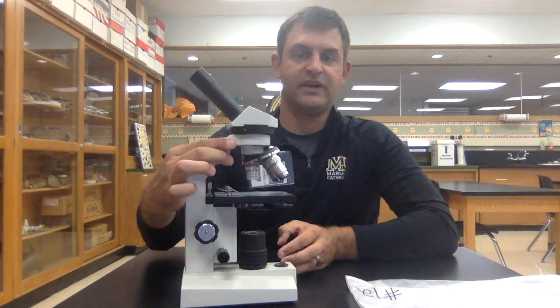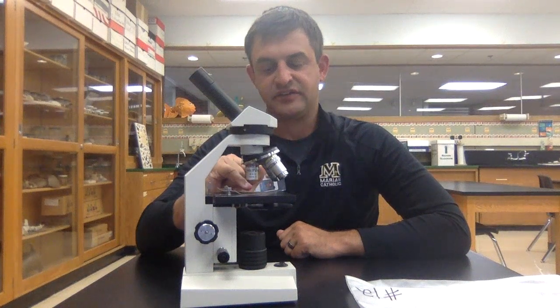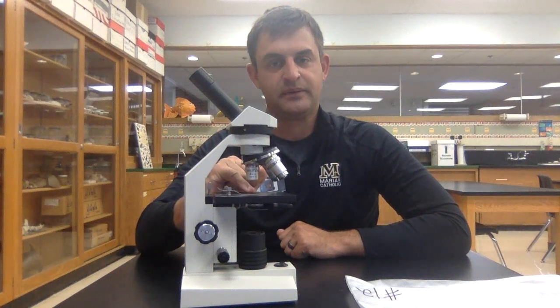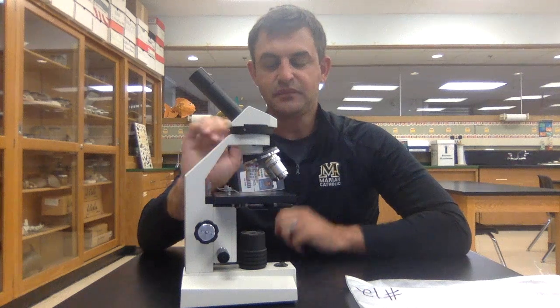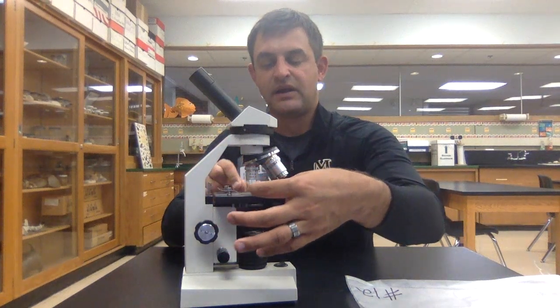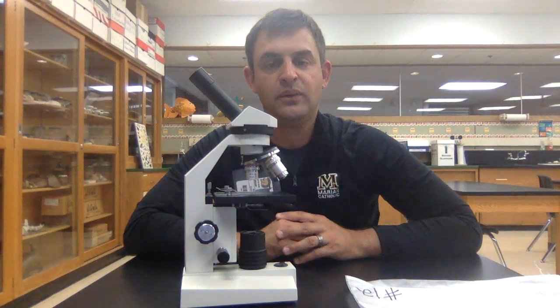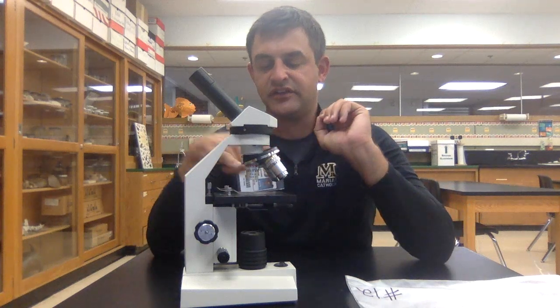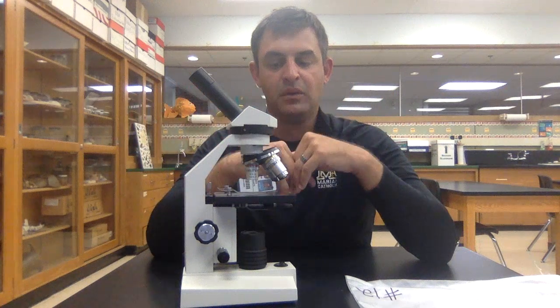So if I turn the microscope this way, you'll see the smallest objective lens is pointing down. While that lens is in place, you can move your slide around, your specimen around to get the image under the lens. Then, of course, you'll focus it, which we'll talk about in a moment.